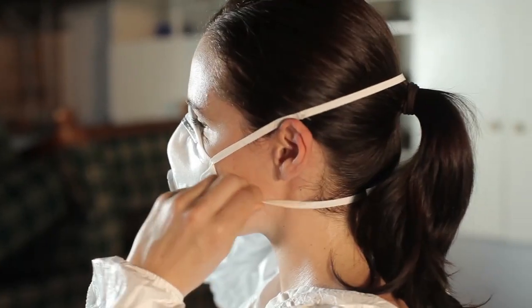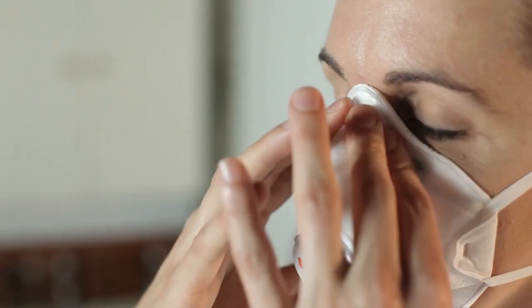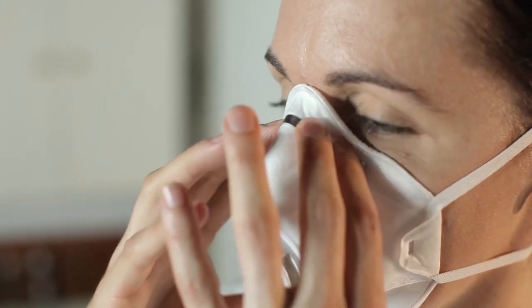If you have long hair, ensure it isn't caught underneath the bottom strap. Using both hands, mold the plastic nose piece to the shape of your nose.